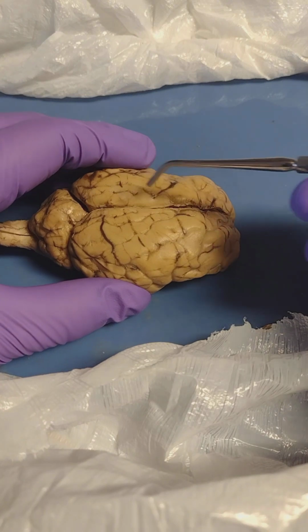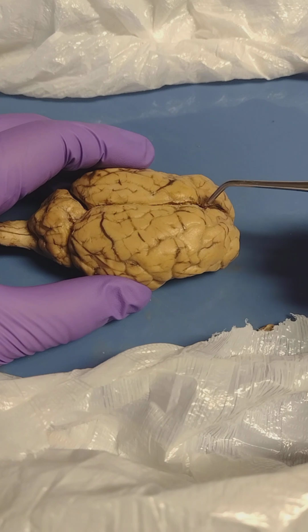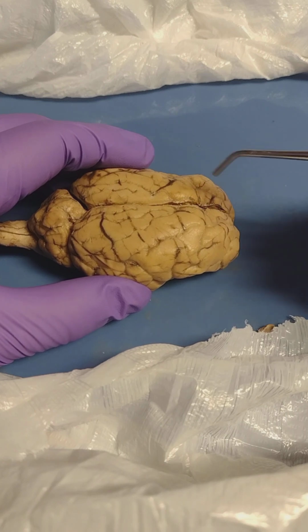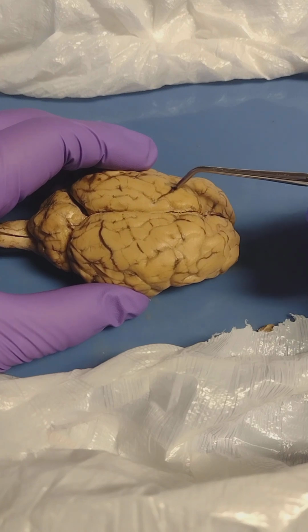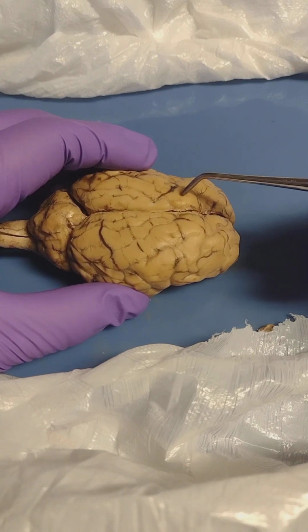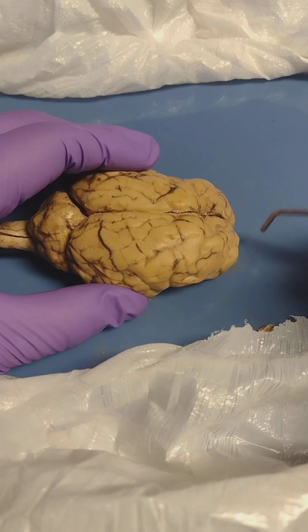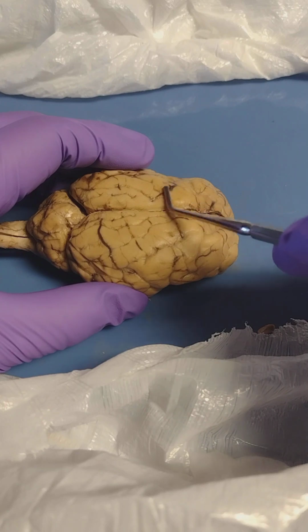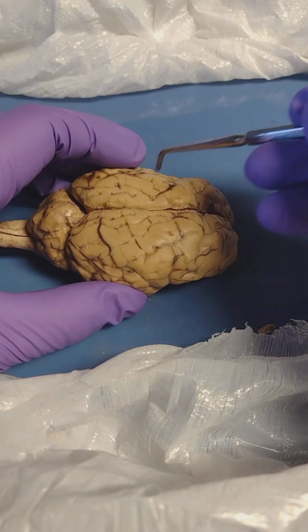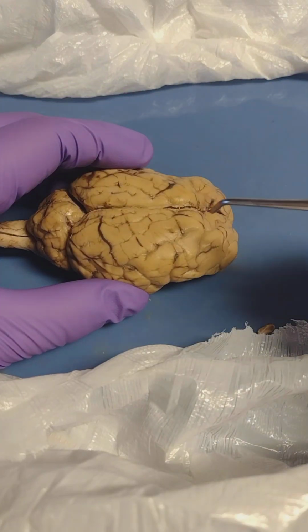As you can see, the cerebrum is divided along this line here. It is known as the medial longitudinal fissure. You can also see grooves and folds. The grooves here are known as the sulci, and then these folds or flaps are known as the gyri. The cerebrum is made up of four lobes. You have the frontal, and then behind that, or posterior, you have the parietal. You have the left and right temporal lobes, as well as the occipital lobe here in the back.